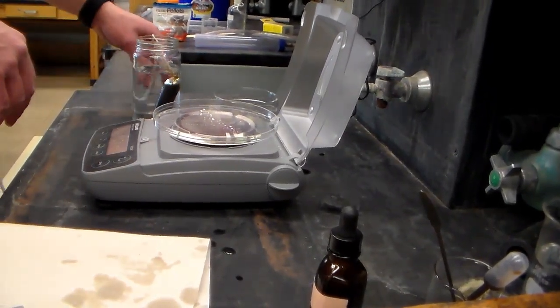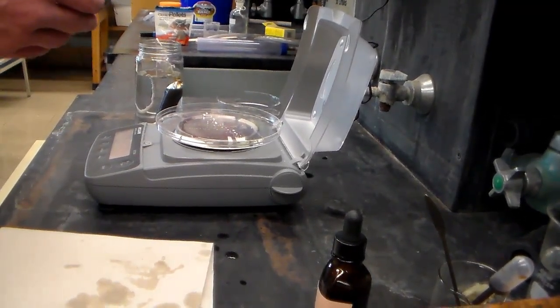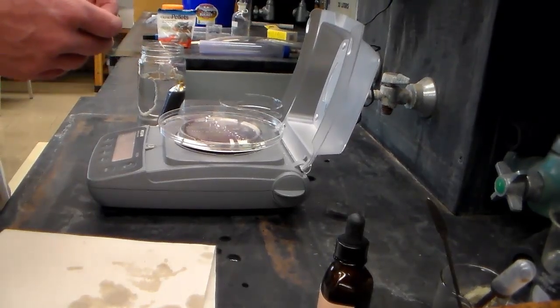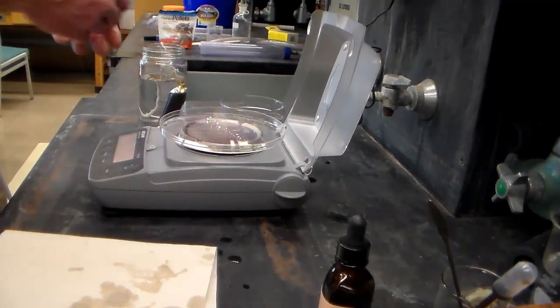And start your timer. We're going to wait another five minutes. Then we're going to do this several times for about a half an hour, so you want to get about six weighings on each of your tubes before you're done.